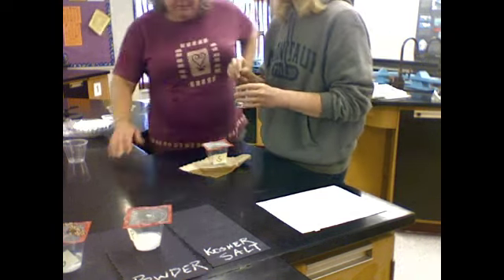All right, well, now that we did the screen filter, now we're going to use the paper filter. Do we have to use it for the gravel? We do not, because it said, if the screen filter doesn't separate the mixture, repeat the process with a filter paper. So we were able to separate the gravel with the screen filter, so we don't have to do that with the paper filter. Now, this is a filter stand, which is a pretty cool contraption. And the thing I always remind people to do is make sure you put a cup under it before you put the filter in.